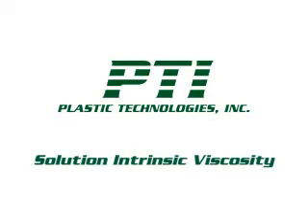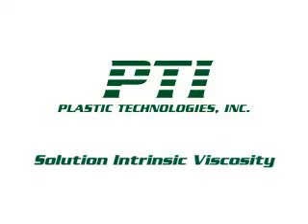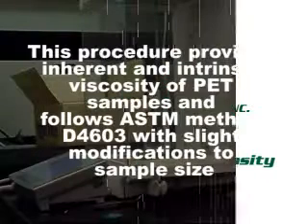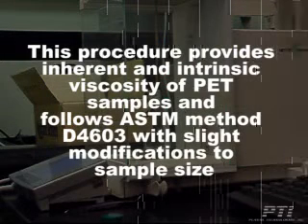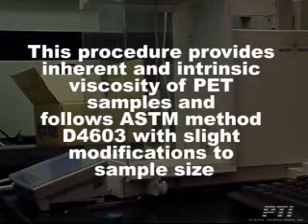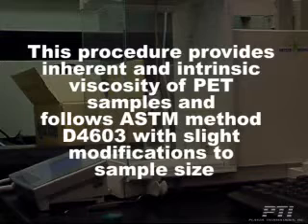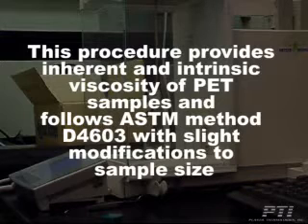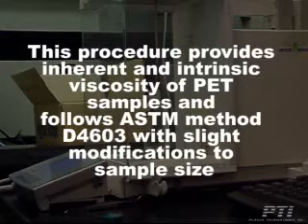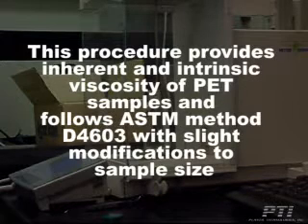PTI Solution Intrinsic Viscosity Procedure using a Rheotec RPV1 and Rheotec SP1. This procedure provides inherent and intrinsic viscosity of PET samples and follows ASTM Method D4603 with slight modifications to sample size.